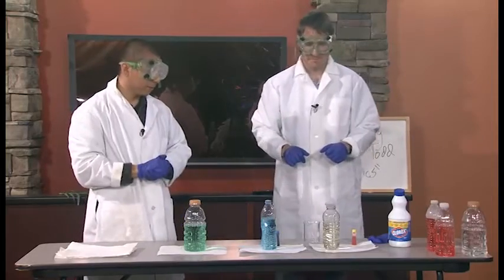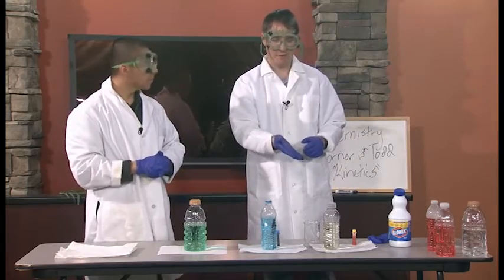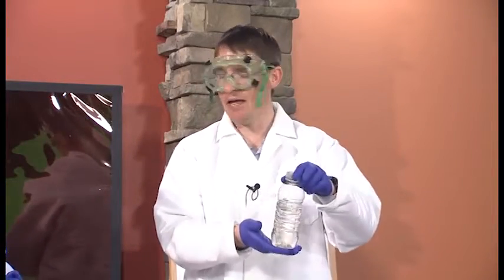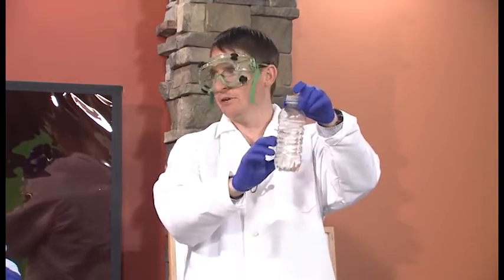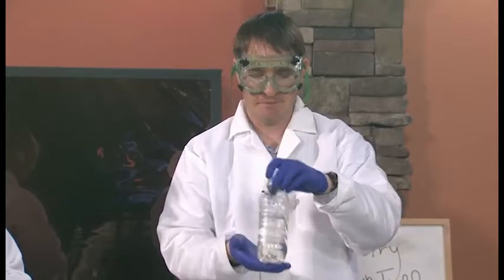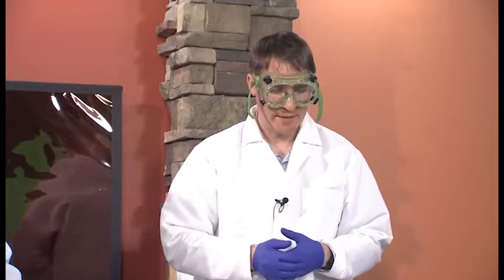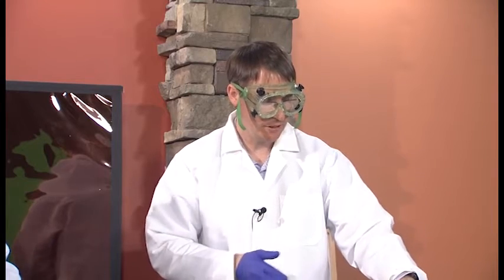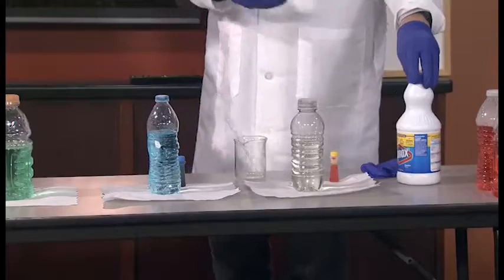Wow, that one's already colorless. Yeah, the yellow one's already colorless, just within a second or two. Even if you notice very carefully, even before I had a chance to shake it up, half of the solution was already turning colorless. Yes. So even that shake of 2 seconds was enough to render it completely colorless. So we can say then that for this particular reaction, bleach is able to react very quickly with the yellow food dye. I was right.